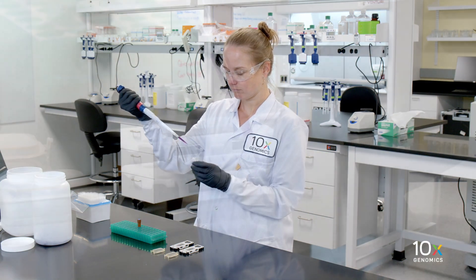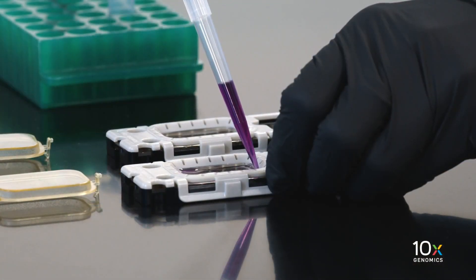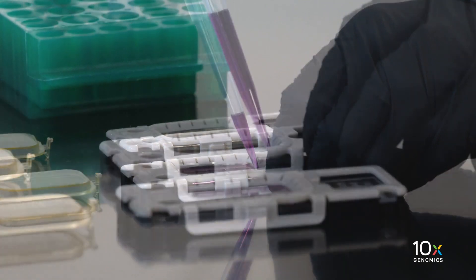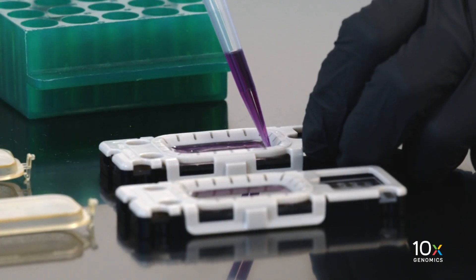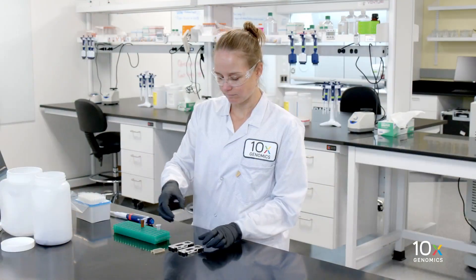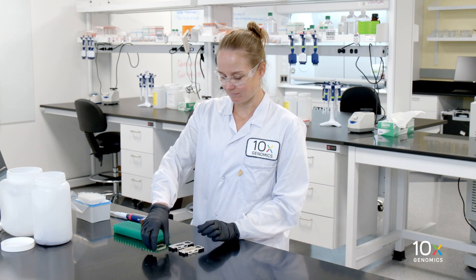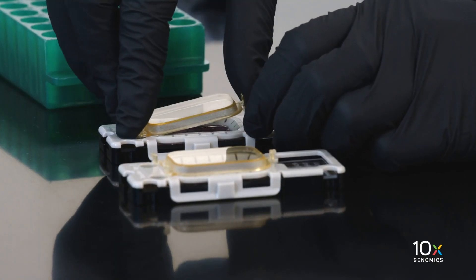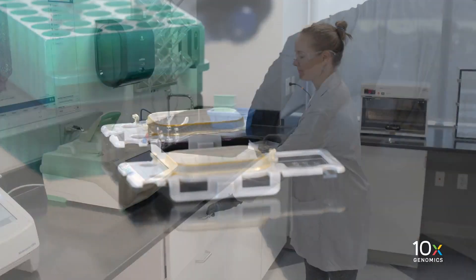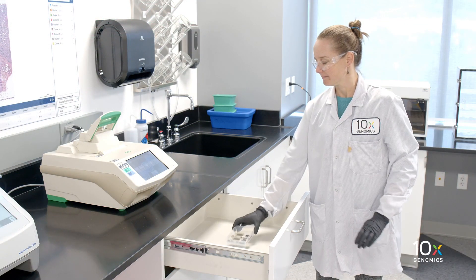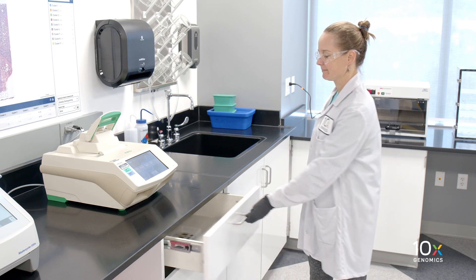Dispense the quencher into the well. Seal the slide cassette with a cassette lid. A secure seal will help minimize solvent evaporation. Carefully move the sealed slide and incubate in the dark for 10 minutes at room temperature.